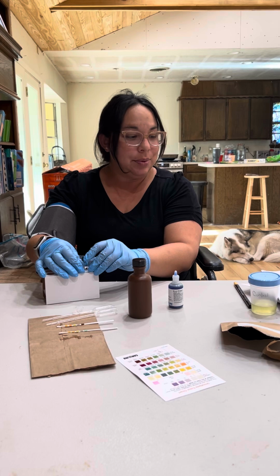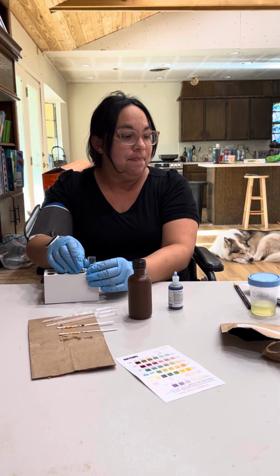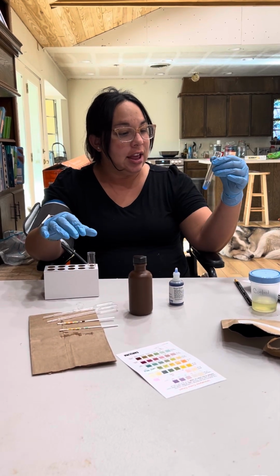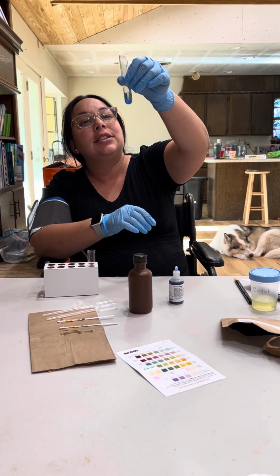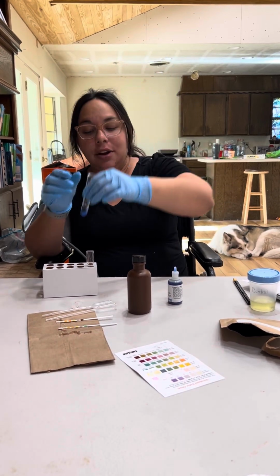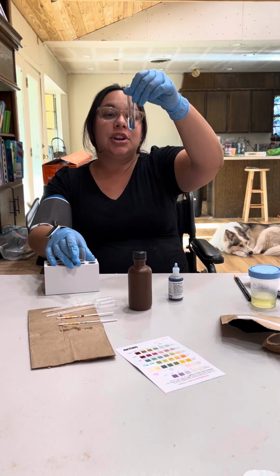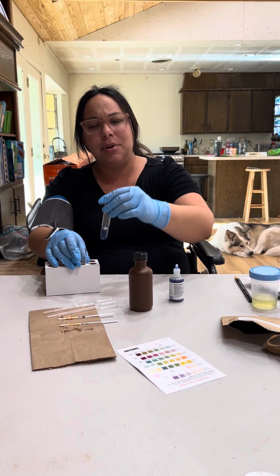So essentially what's supposed to happen is when I put it in there, I observe the reaction. If you see the control group, it's kind of down at the bottom there, and solution A is all throughout. Interesting. Did I put them in the right ones?